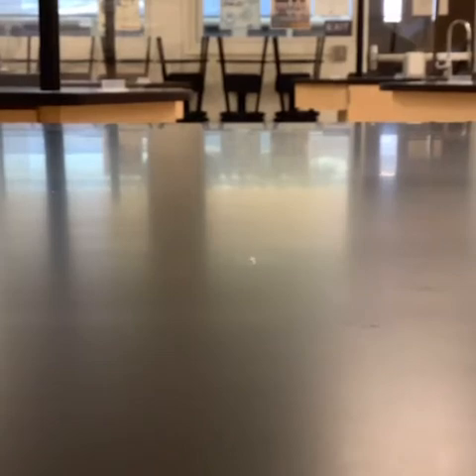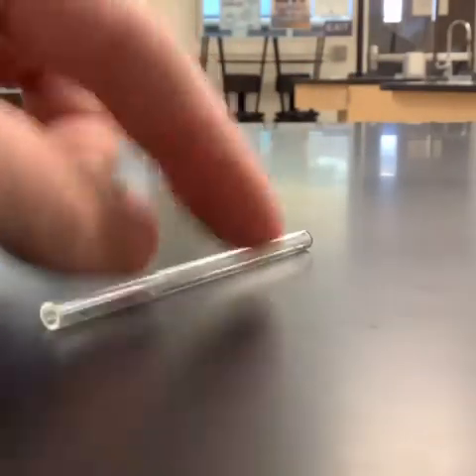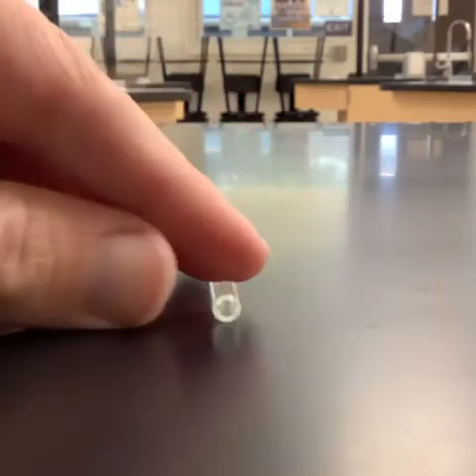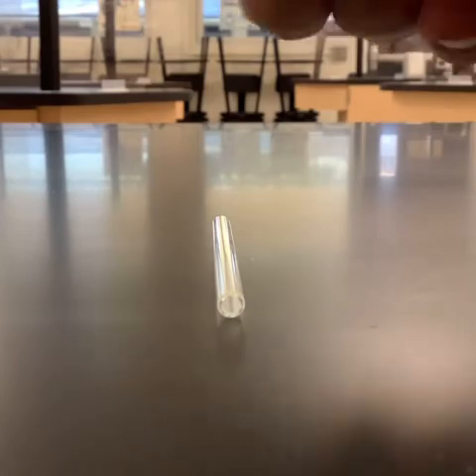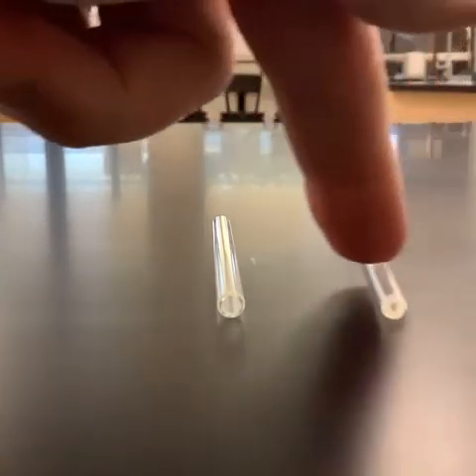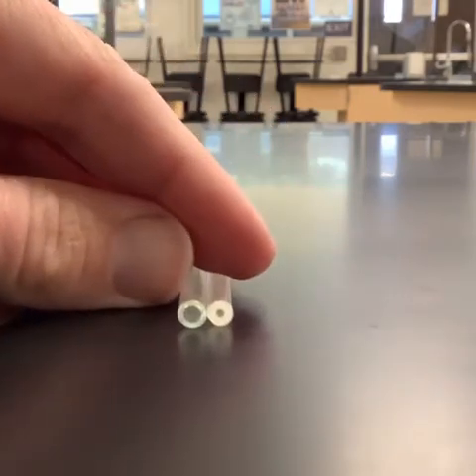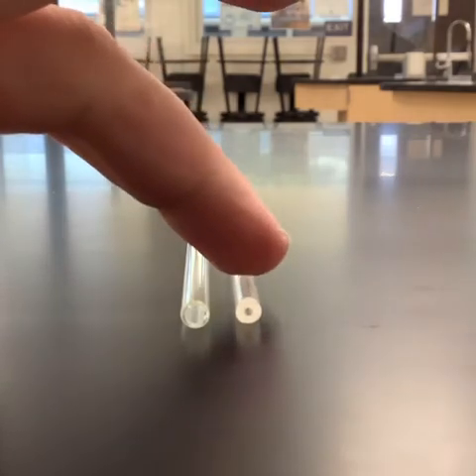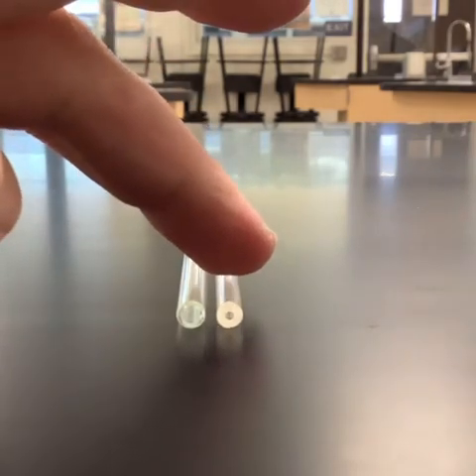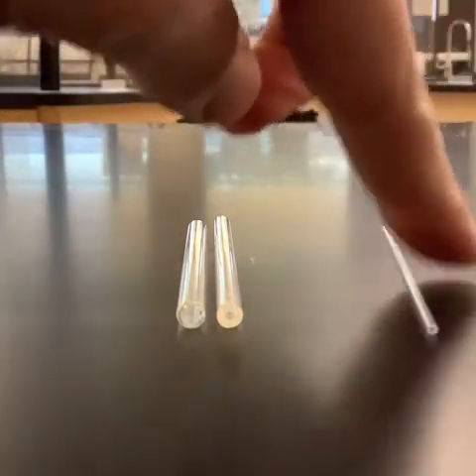The next part, what we're going to be using is a bunch of little glass straws called capillary tubes. So basically what we see here is a little glass tube. This is what we're going to call the large tube. The next little glass one we have here is what we're going to call the medium tube. And so if we look at those inside diameters here, we can see that one is quite a bit larger than the other. And then we have one final one, and we're going to call this one a small tube.